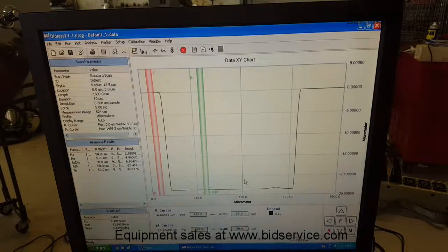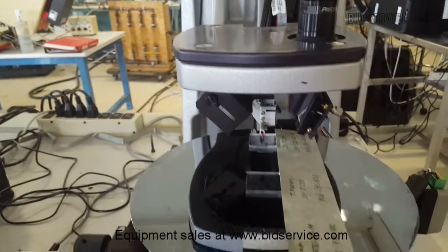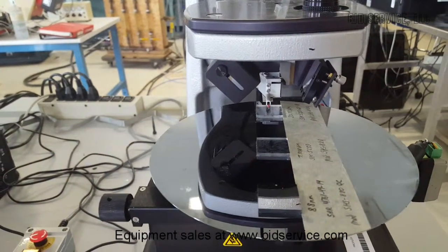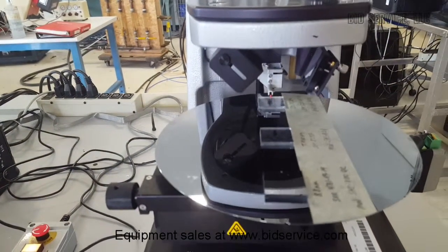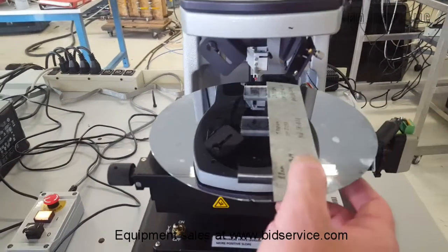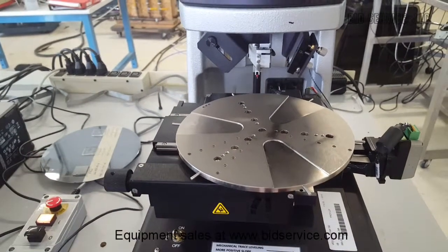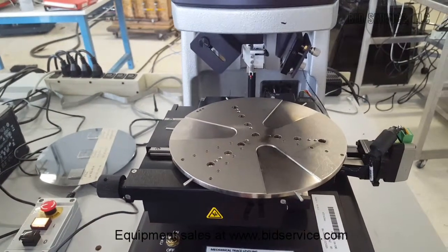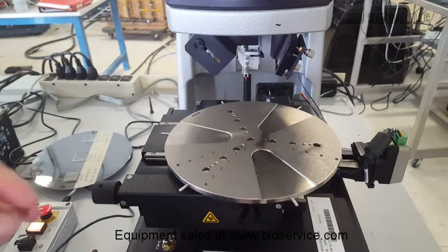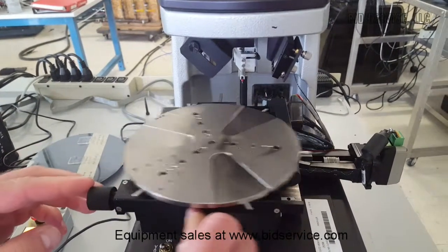The last thing I want to show you is on the stage. The way the stage is set up, as I explained earlier, for the 3D option you use the motorized Y. That's how it's indicated in the book. And you have the manual in your course.